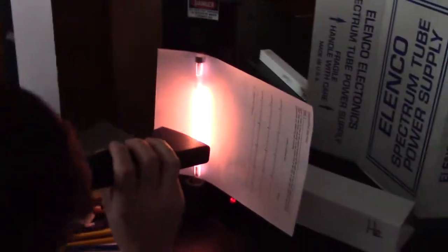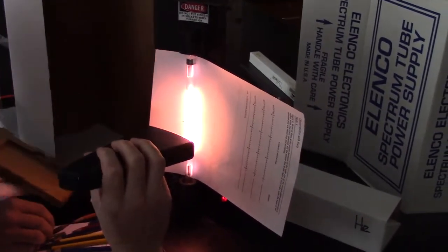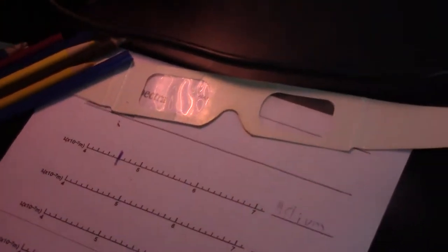I'm going to look through here, and oh my goodness. I have no idea if the cameraman can see what I'm seeing right now, mainly because he's knocking me around the room. Can you see the lines? There's the lines. So what I need to do is there's a scale there, and I see a purple one right in the middle right now, and it's at 460 nanometers. So it would be 4.6. So I'm calling out. Sam is now going to make a purple line at 4.6. Great!